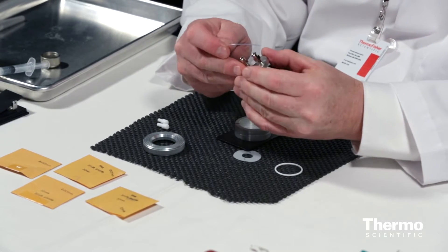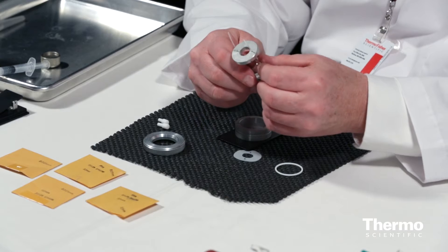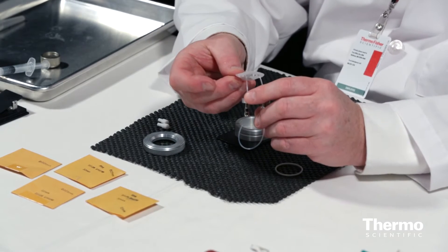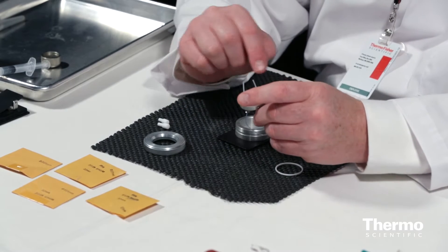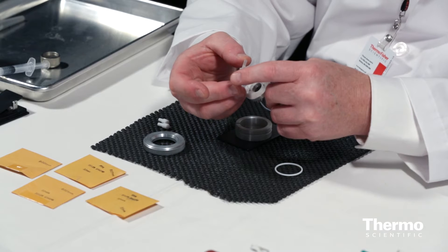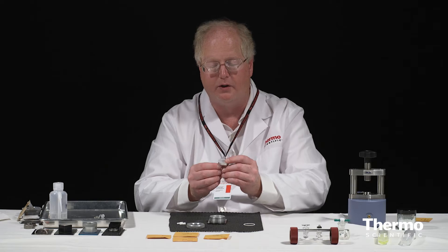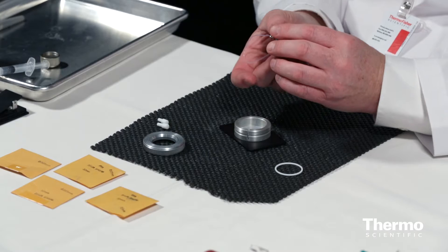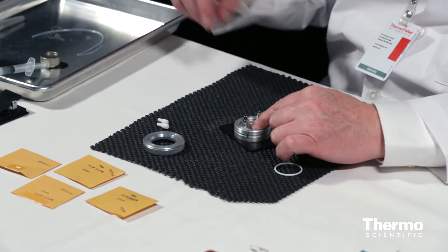I'm going to pass this piece of tubing through the two fill ports of the cell until it comes out the other side — a very convenient way to assemble the various parts in alignment. The next part to go on is the teflon spacer at the top, used to make the seal with the top window. Then finally I place the upper window, sliding it through the two small holes. When I invert the whole assembly, the tubing keeps everything in alignment.